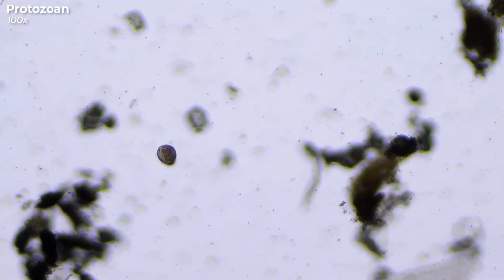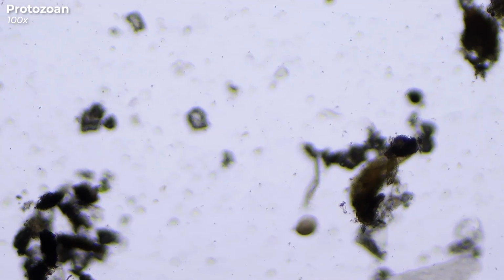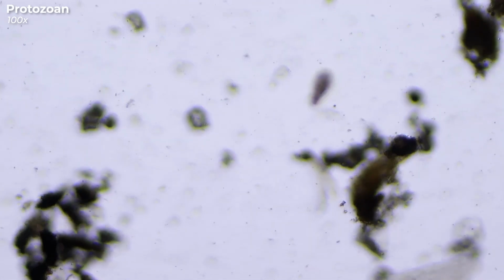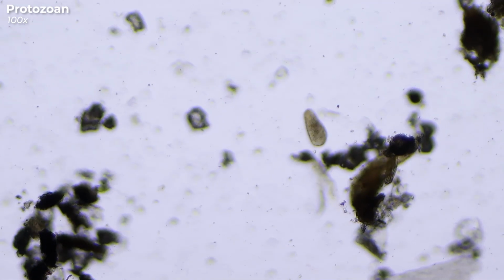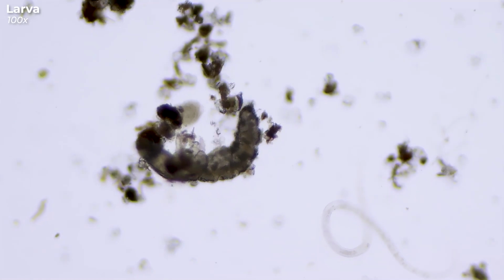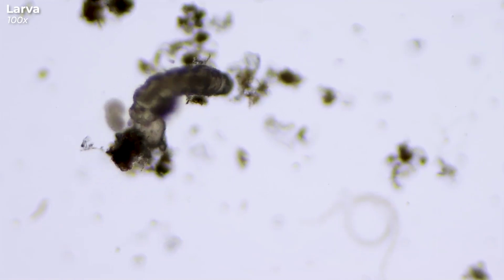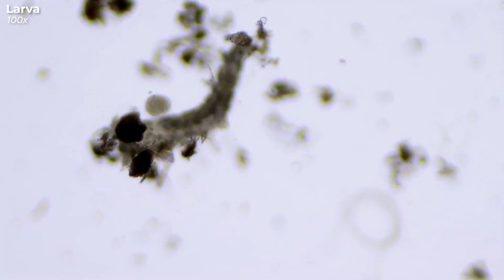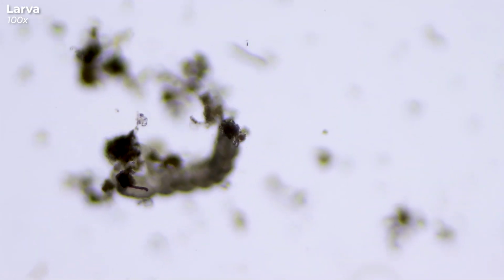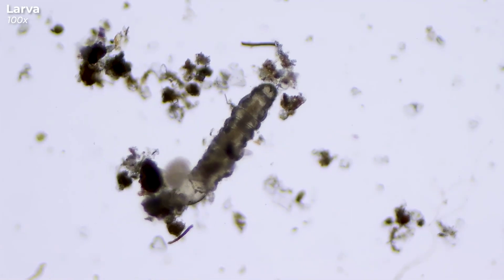But there are many other tiny creatures hiding in our forest moss, like this dancing little protozoan here, which looks a bit like a strangely shaped potato. Or this larva of a beetle or a mosquito, which is visibly annoyed by the fact that all this plant material is attached to it and it can't get rid of it. To make matters worse, it also gets bugged by a very cheeky colpoda. Poor larva, it seems to have a rough day.